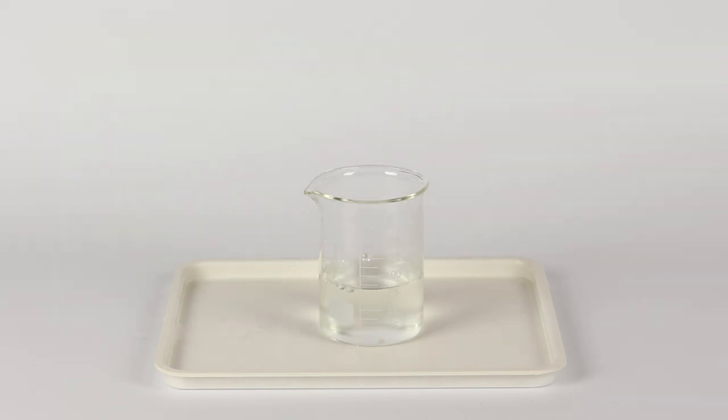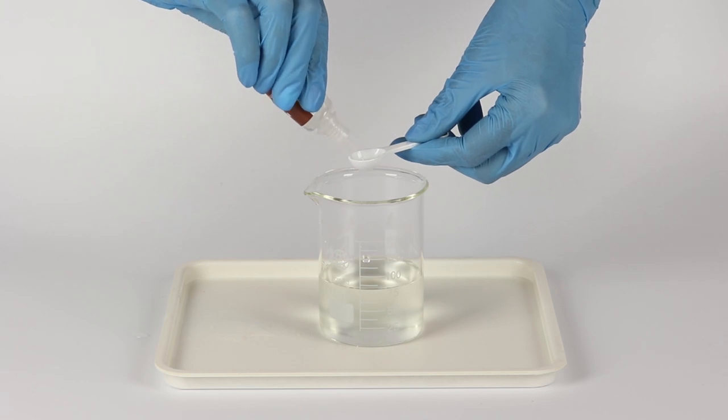Now, add a substance containing iodide ions, potassium iodide, and a reductant, sodium thiosulfate. Add five drops of sodium thiosulfate solution to the beaker. Add two big spoonfuls of potassium iodide solution.